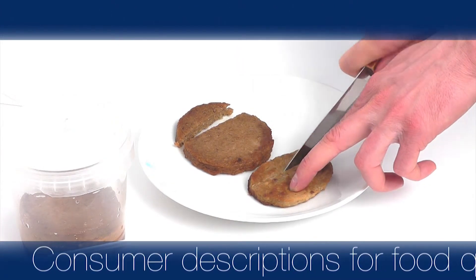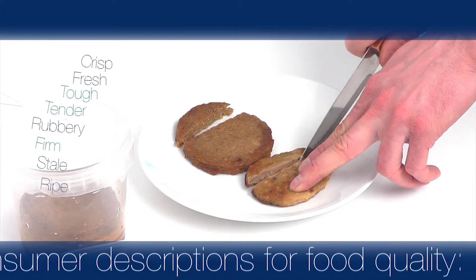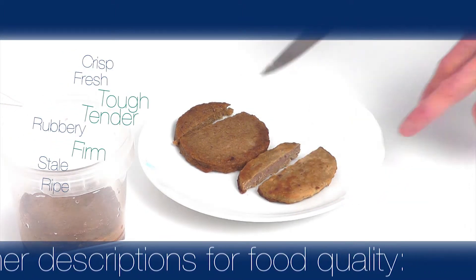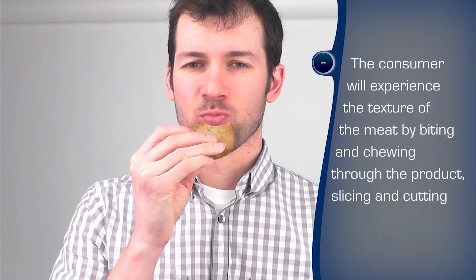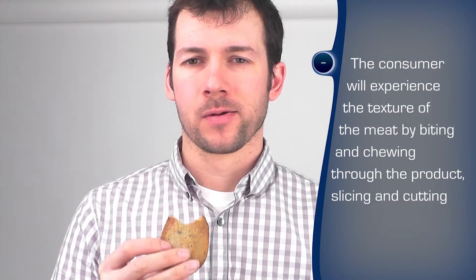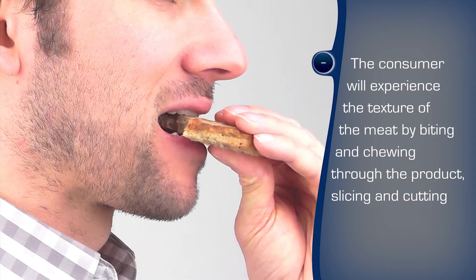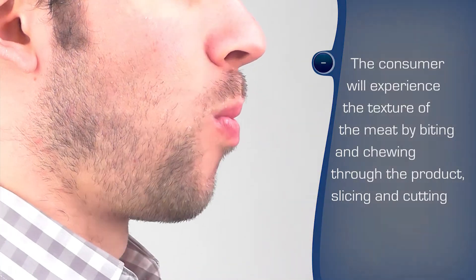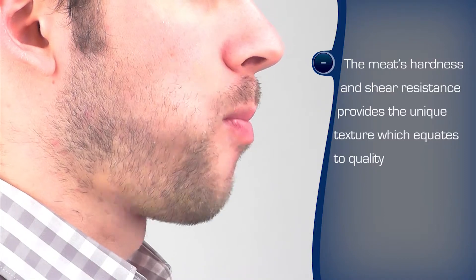Consumers judge the quality of food in a sensory manner, evaluating the texture primarily through touch, mouthfeel, and other ways as they interact with the product. For a comminuted meat product, a firmness of texture across the whole item is required — a texture which can be regarded basically as meaty.